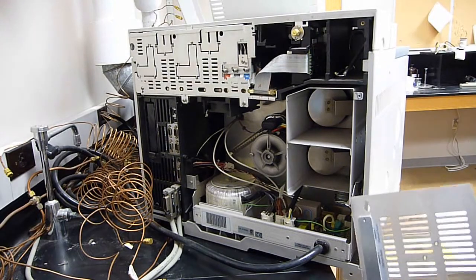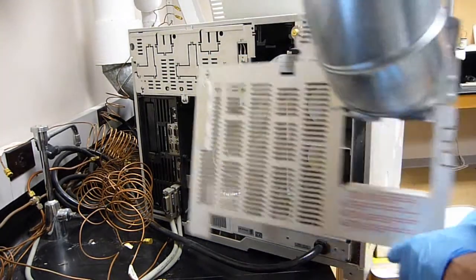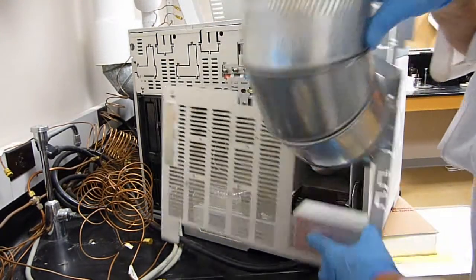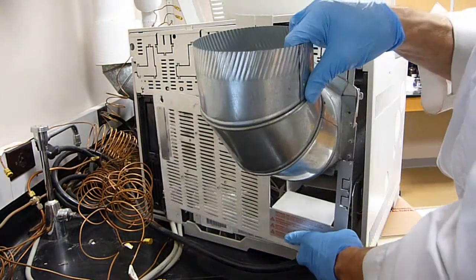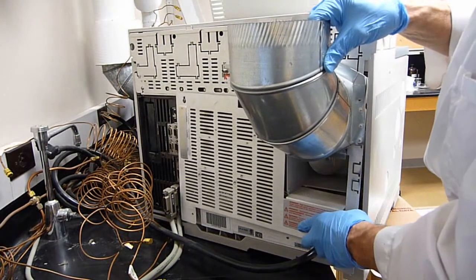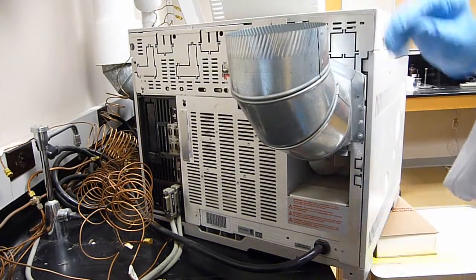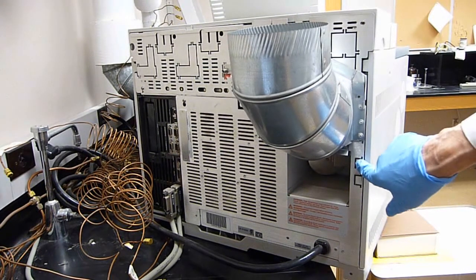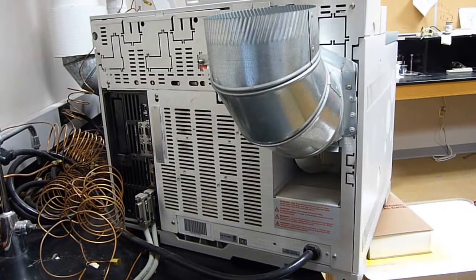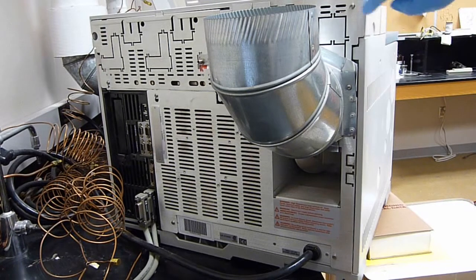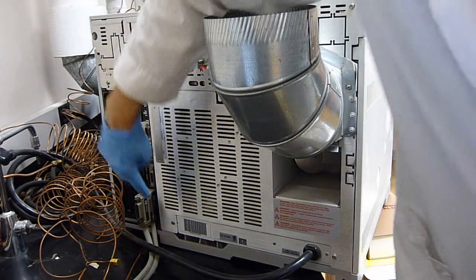This is the back of the GC. And we're gonna put the rear panel on. Remember, it's power unplugged. And there are five screws that hold this to the chassis. The five screws are located one, two, three, four, five.